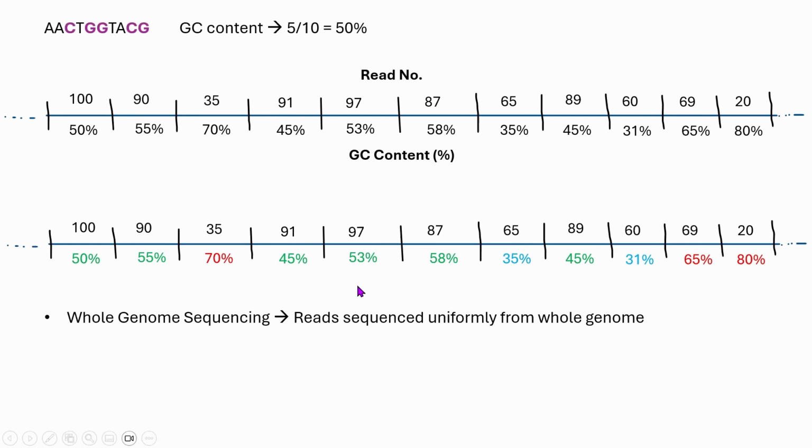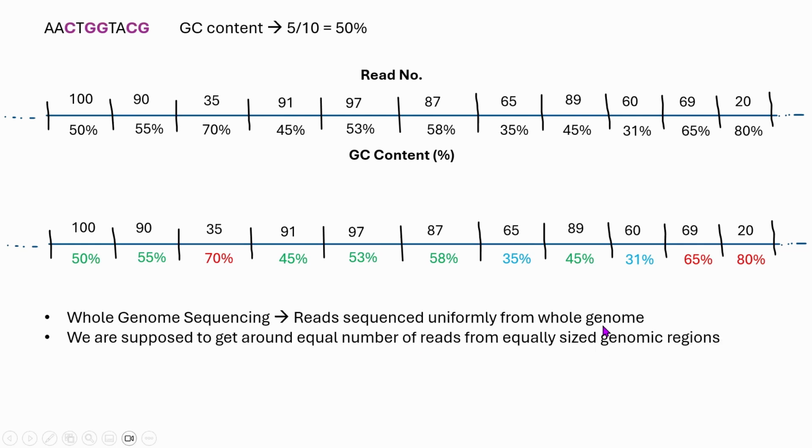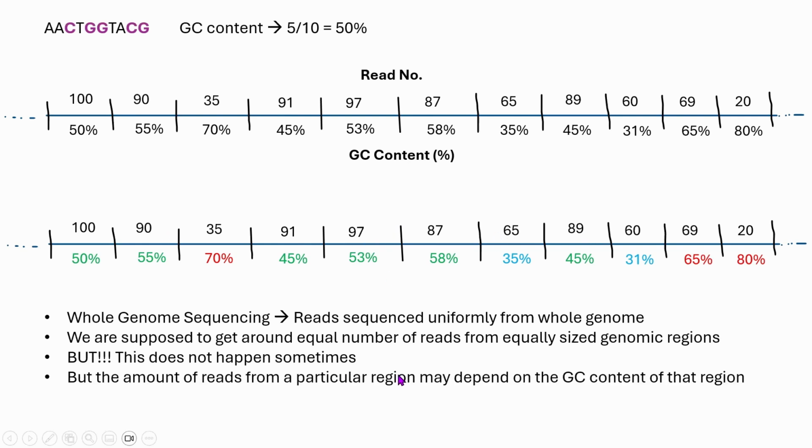So first of all, when we do whole genome sequencing, the reads are supposed to be sequenced uniformly from the whole genome. What does that mean? That means we are supposed to get around an equal number of reads from equally sized genomic regions. That means each of these regions should approximately give us the same number of reads. But this is not happening here, as I showed right now. And the amount of reads from a particular region can depend a lot on the GC content of that region. For example, you can clearly see right here.